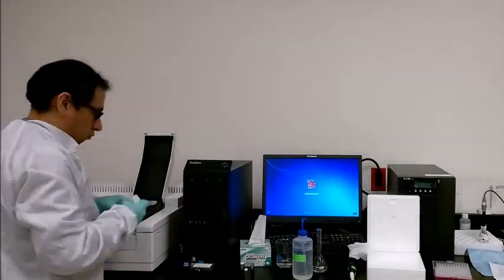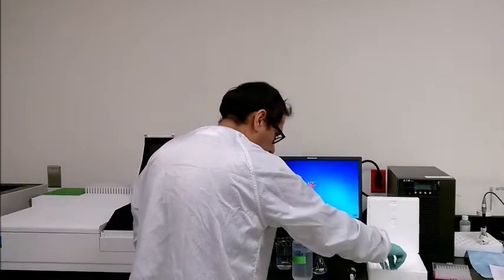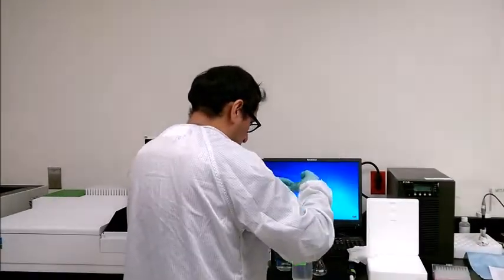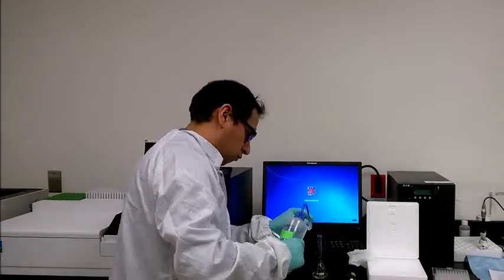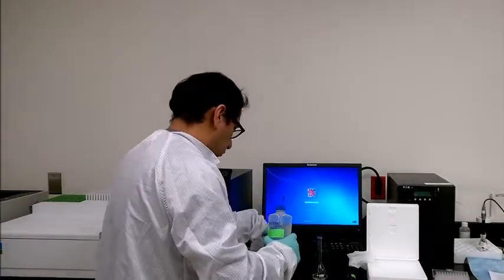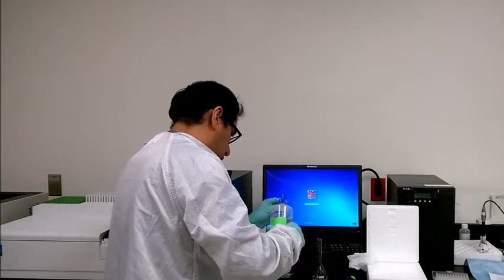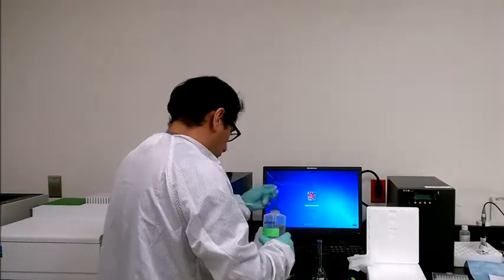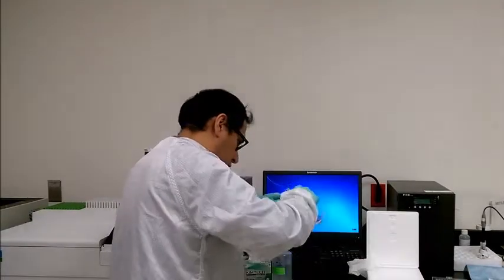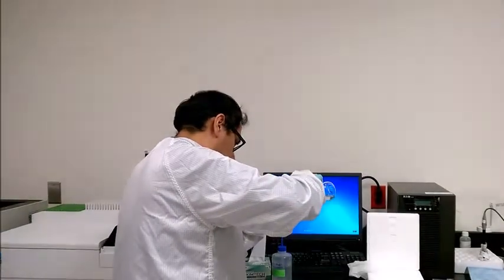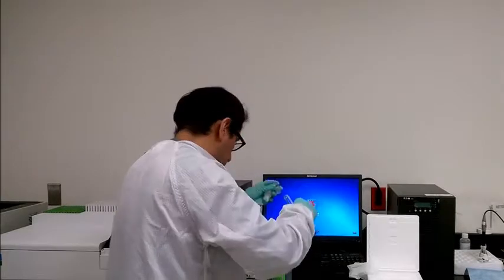The sample cuvette containing the solution must be rinsed at least two times with the solution. Then the cuvette must be filled at least three quarters of each side with the solution. Clean the transparent sides with Kimwipes and then place it in the sample holder.